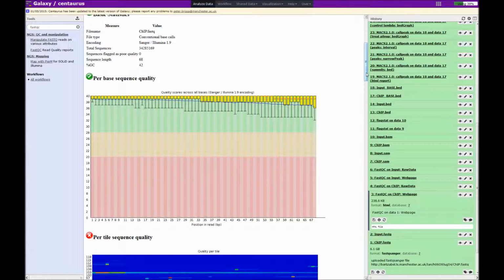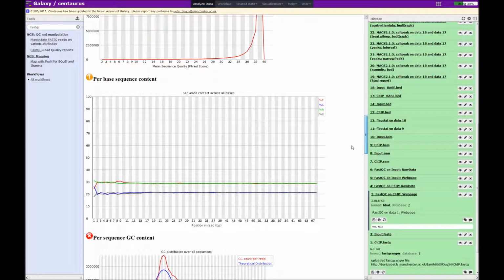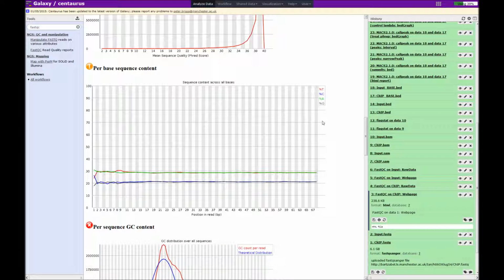The next result I want to mention often looks like there's a problem, but is just part of the Illumina sequencing results. So here we have the per base sequence content that shows the proportion of A, C, T and G along the length of all the reads. You quite often see in the first 9 or 10 bases that there is a curious wiggle in the distribution, and this is because Illumina sequencing uses random hexamers to populate the flow cell prior to sequencing. However, these random hexamers are not truly random, giving this unusual distribution.